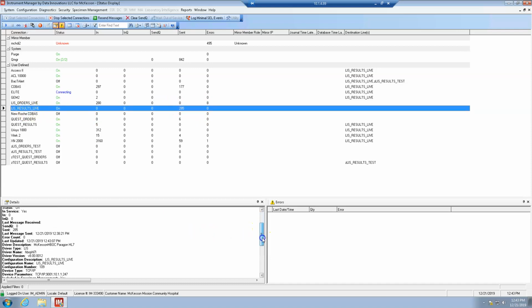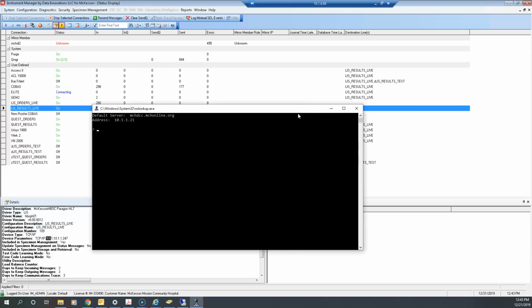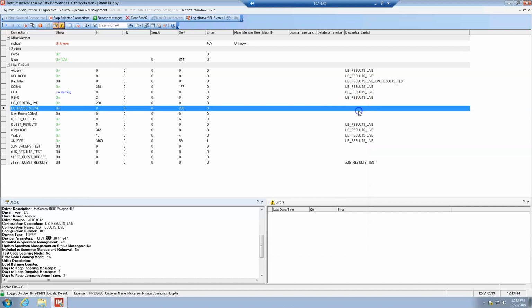Okay. We're going to go down here. This is listening on 9000, 9001. So that's going to be important later to pinpointing it. Also, I'm sorry, not listening. This one is sending on port 9001 to IP 10.1.1.247. So what's 247? You guessed it. Give me a second. Let me pull up nslookup 10.1.1.247. Bam, it's N tier. Big surprise. Okay, so also good to check if this IP is correct.